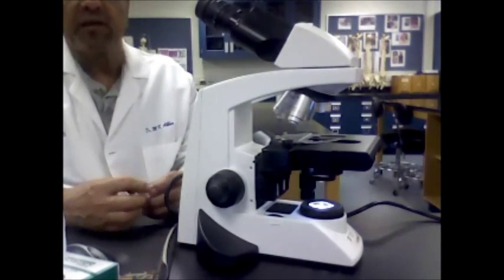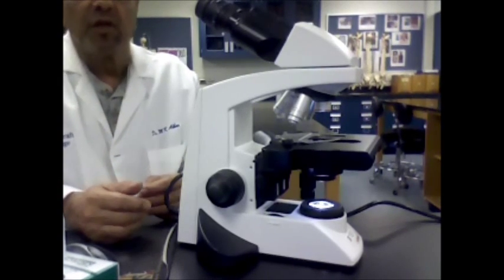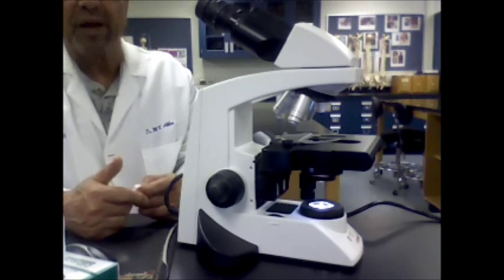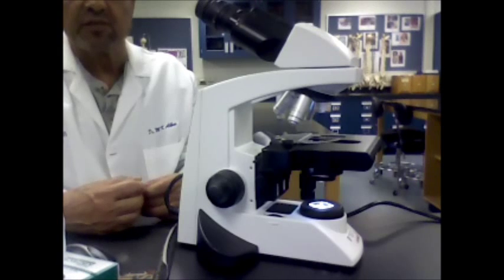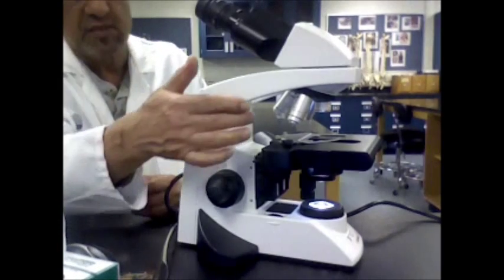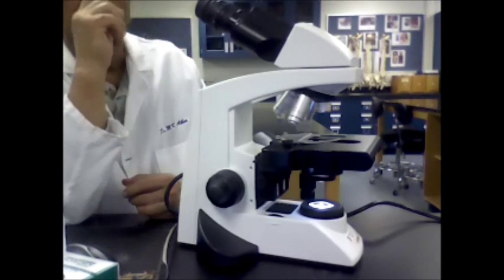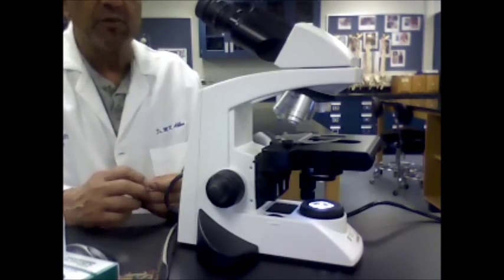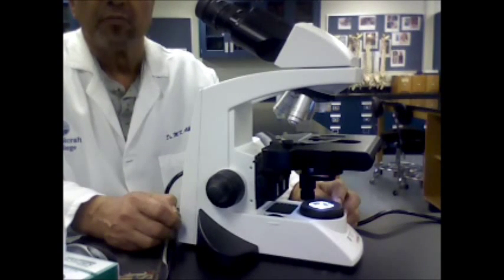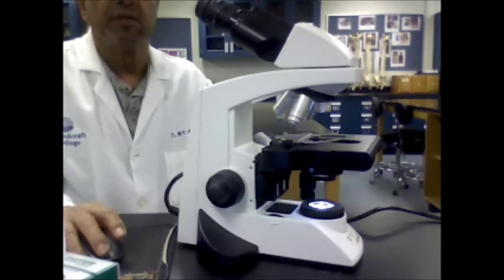It is important to take care of the microscope because it will be used as a tool to examine tissues, cells, or microorganisms. It allows us to magnify the specimen, and the magnification is the result of the power of the objective and the power of the lenses in the ocular. It also provides us with resolution, which is determined by the source of illumination. That is how we use the microscope in the lab.